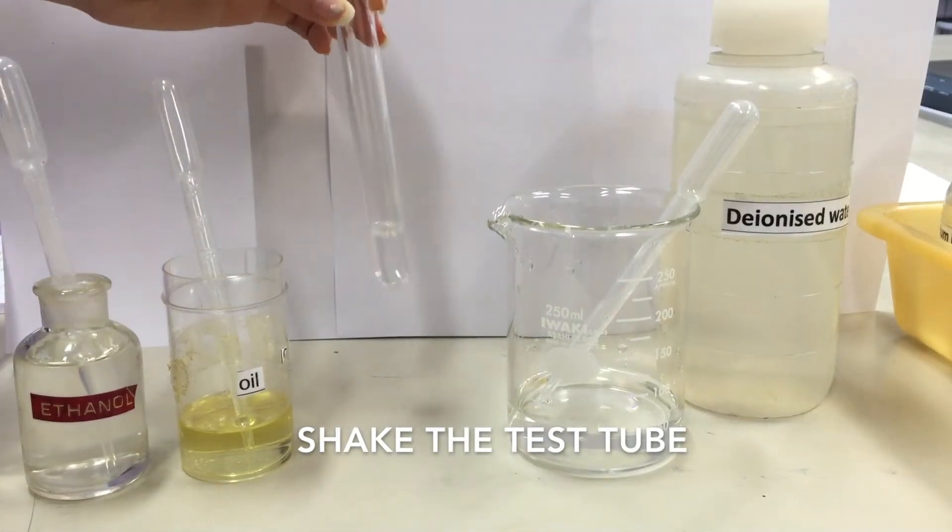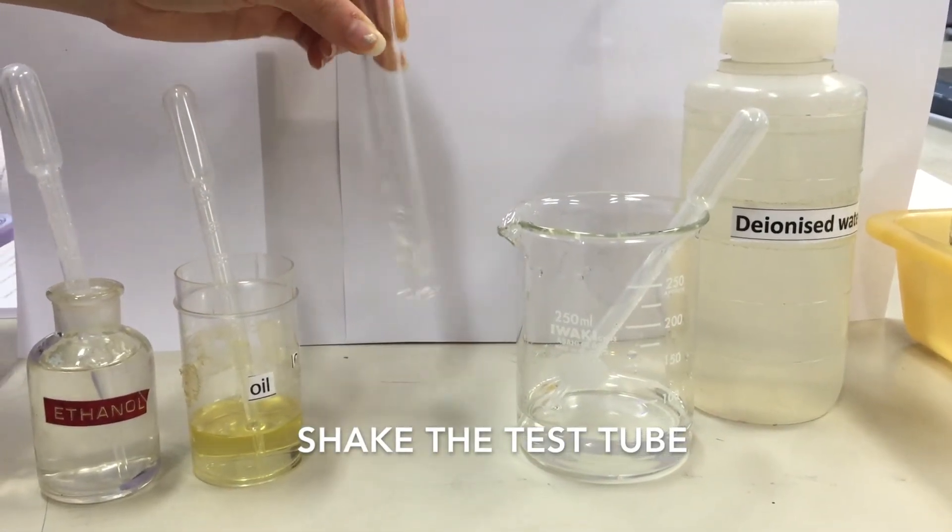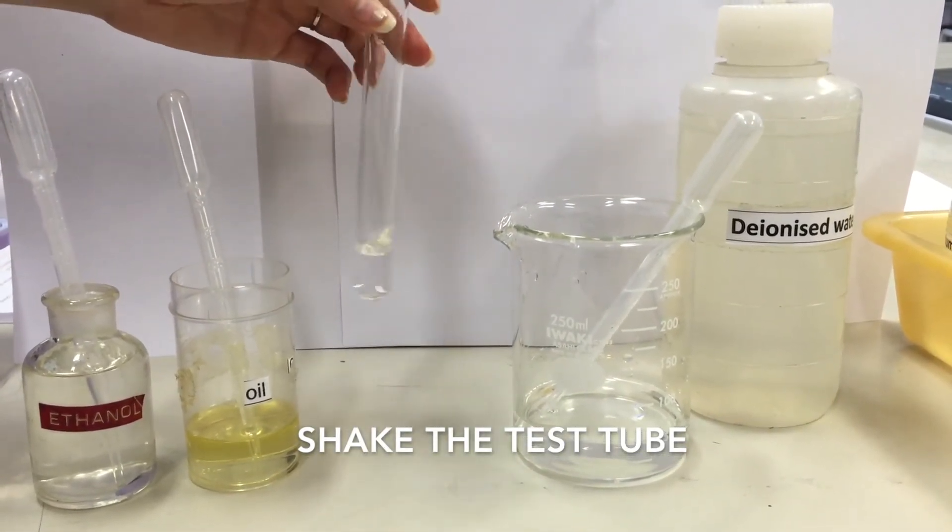Then, we shake the mixture thoroughly for about 5 minutes.